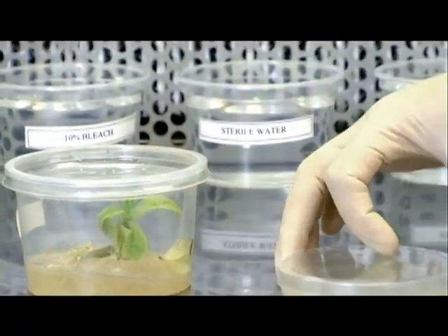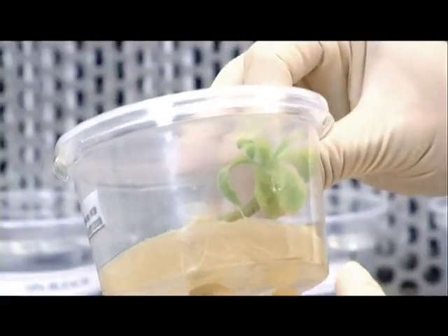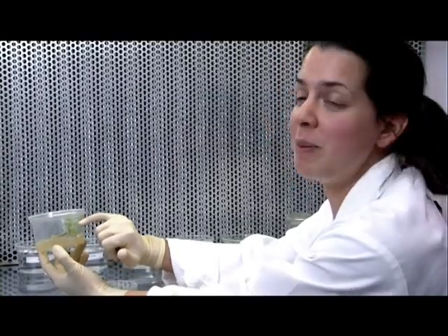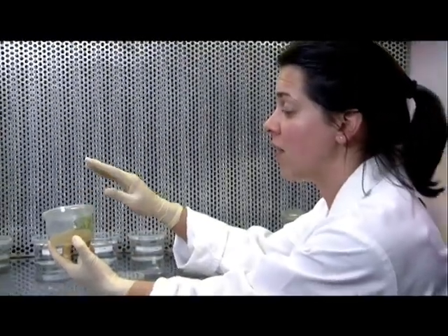Now we're going to take this little explant, which is on its nutrient mix with hormones, and place it into our incubator. After several transfers, we've gone from what we began with — this explant — to this little plant, which as you can see has a very good root architecture now and well developed leaves. That's the end of micropropagation, as this plant is now ready to go out into the soil.